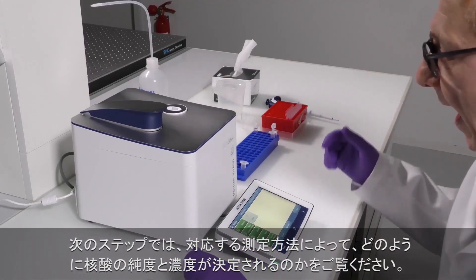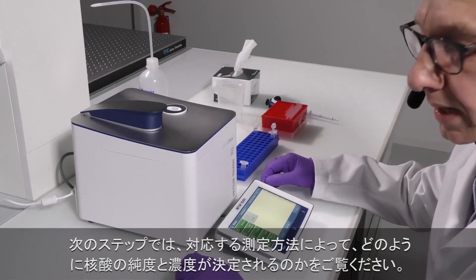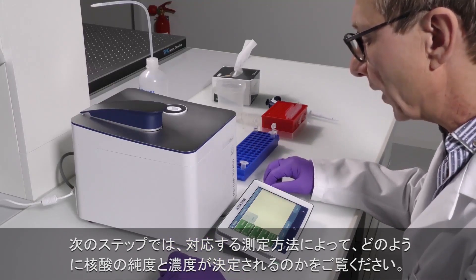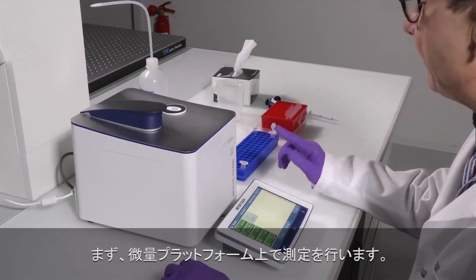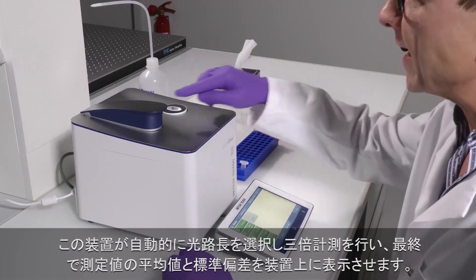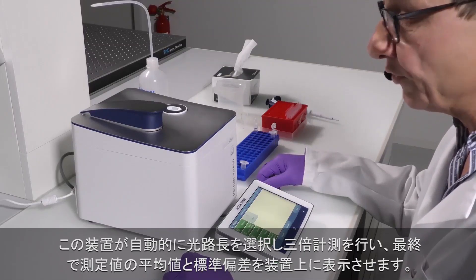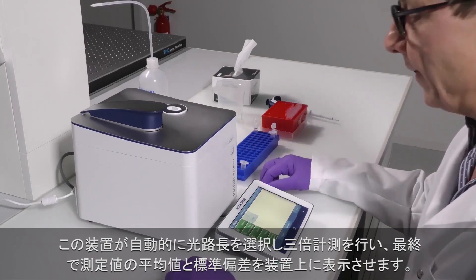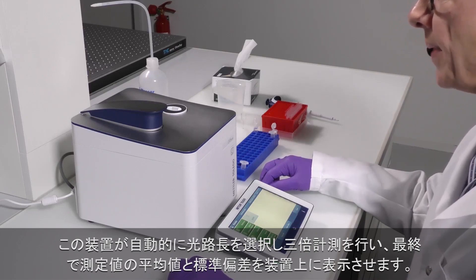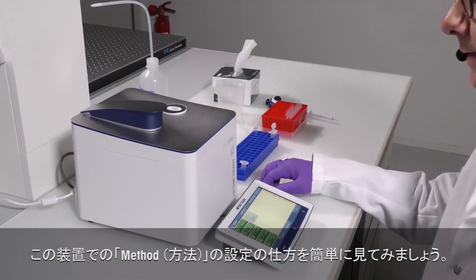In the next step, I will show you how the corresponding measurement method is entered in order to perform the purity and concentration determination of the nucleic acid. We will perform the measurements on the micro-volume platform, we will automatically select the path length, and we will perform a three-fold determination so that at the end we will have the mean value and the standard deviation displayed. Let's quickly have a look at how the method is set up in the instrument.